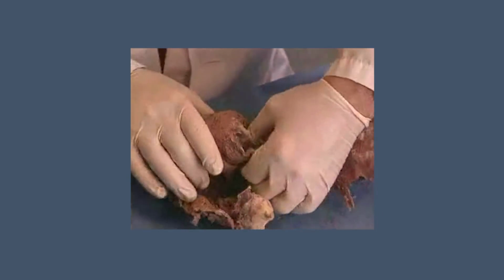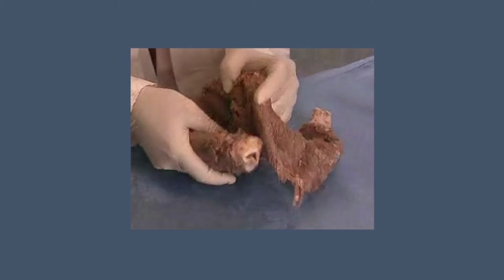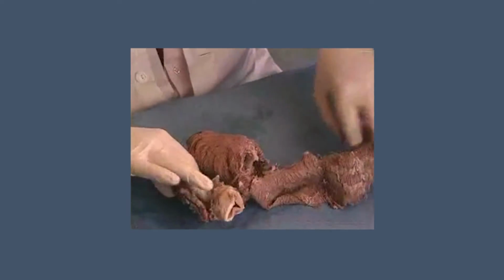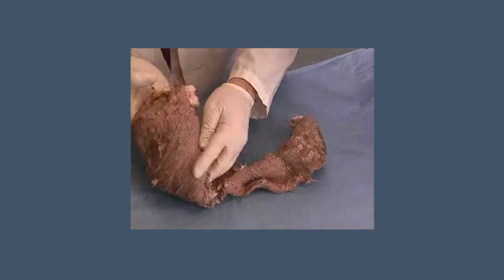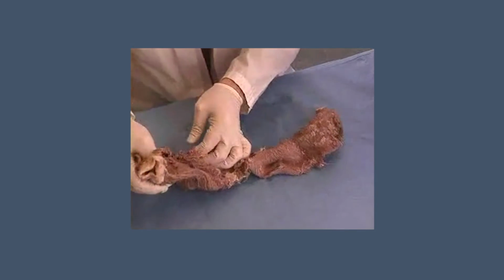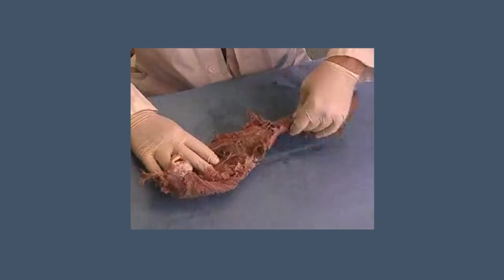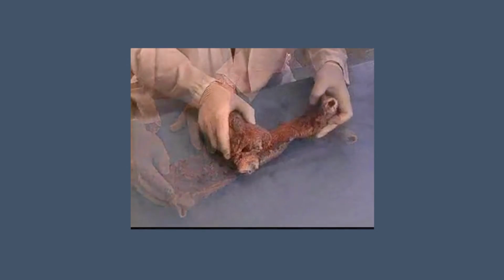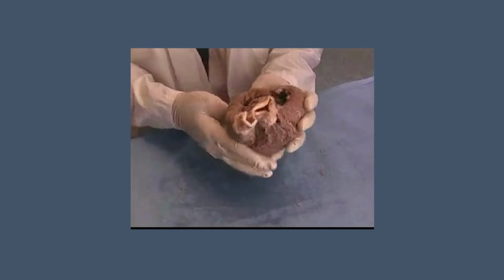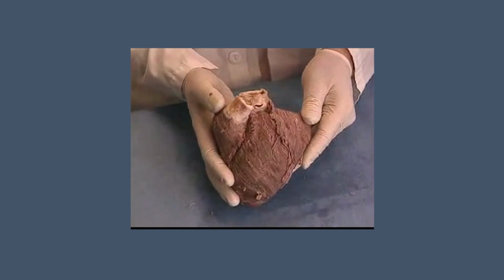Torrent-Guasp continues the dissection, following the cleavage plane, separating the two layers. Then, by cutting the right trigone, he is able to free the aorta and unravel the myocardial band. The ventricular myocardial band, running from the root of the pulmonary artery to the root of the aorta. A singular muscular band that twists and loops like a rope into a helical structure, forming the left and right cavities of the ventricles.